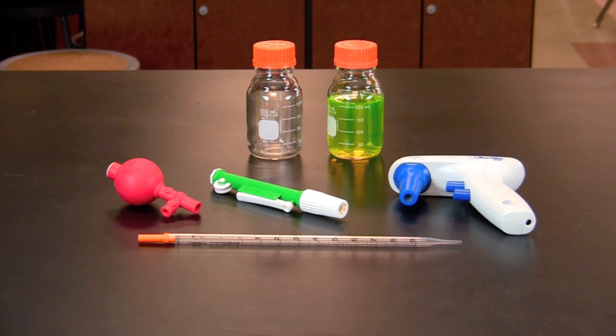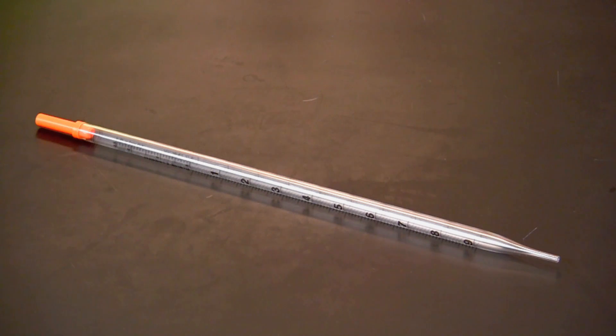In this video, you will learn how to use a serological pipette in a variety of pipette pumps. Serological pipettes are a type of graduated pipette commonly used to measure volumes over one milliliter.